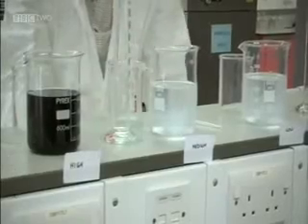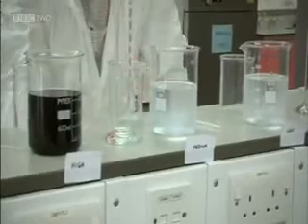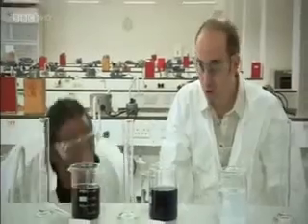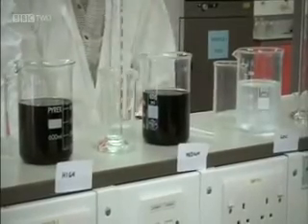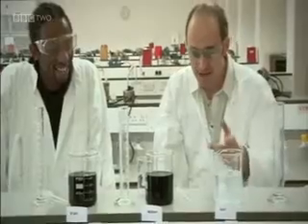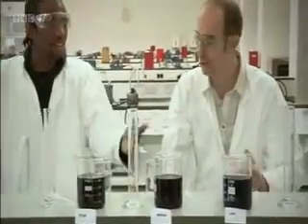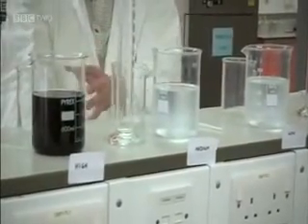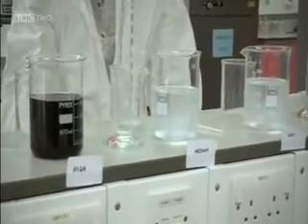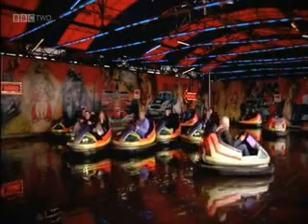Whoa! There went the first. As expected, the firm favorite — high concentration — comes storming through the finish line. There went the second one. The runners are coming in exactly the order we're expecting. He's been out of training or something — there he went. Of the three solutions, it was the solution with the highest concentration that resulted in the quickest reaction, because the reactant particles are more crowded, so collisions take place more frequently.